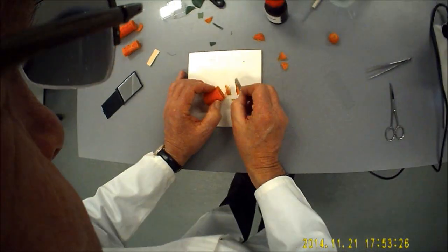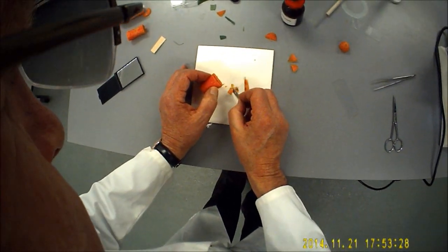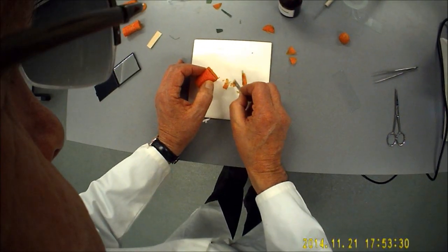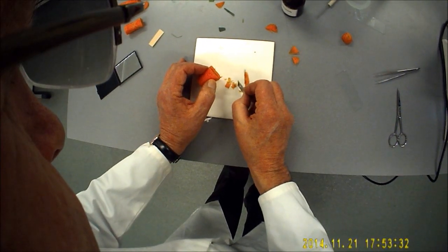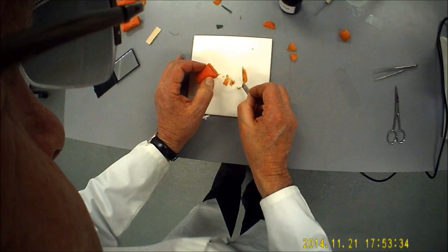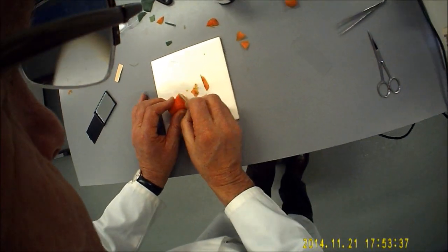Like so, that's hugely thick but some of these aren't bad. The one in there for instance, that's not bad, that's not bad. We'll keep going.